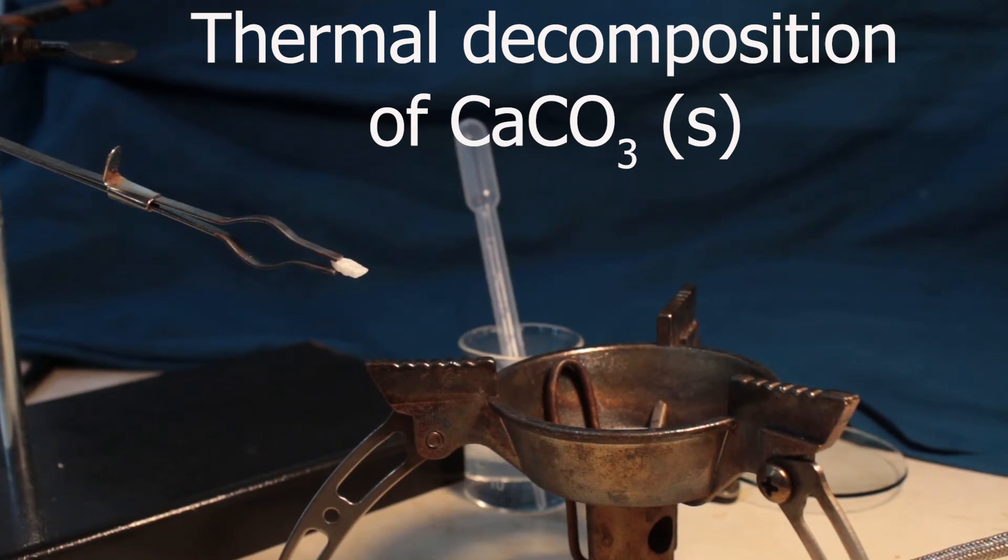Hello guys, welcome to Sergei's Chemistry. Today I'm going to show you thermal decomposition of calcium carbonate.